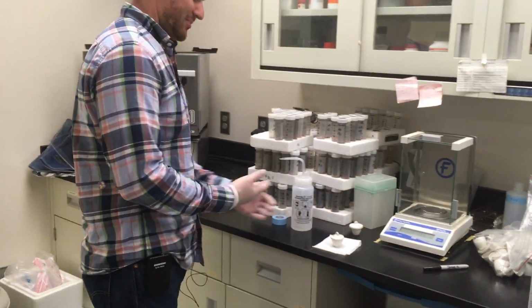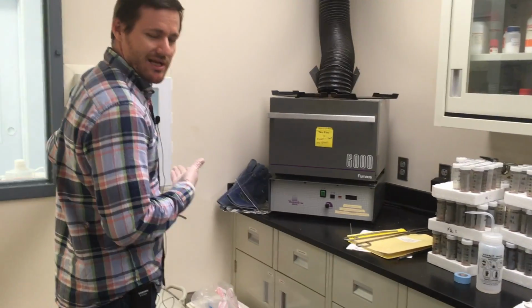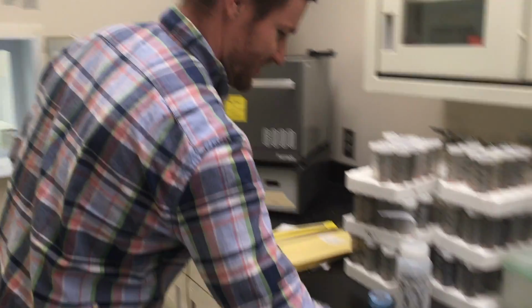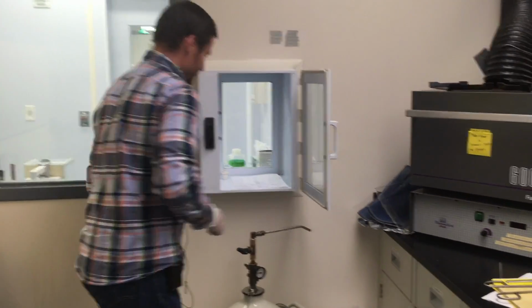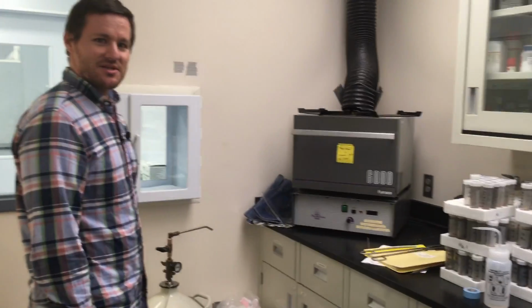And so once all my samples have been remarked, for my purposes, my samples will go back in the clean lab for a lot of the things I do. I will put them in this holding space, this kind of purgatory, where samples that have been ashed are ready to be weighed out inside the clean lab for digestion. And so that concludes today's lesson on the asher.